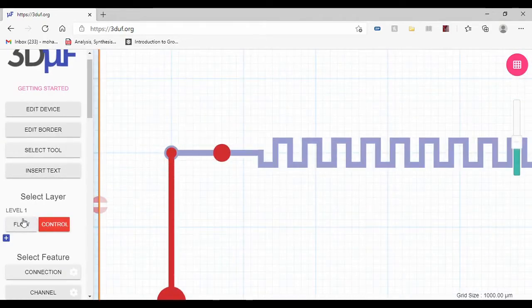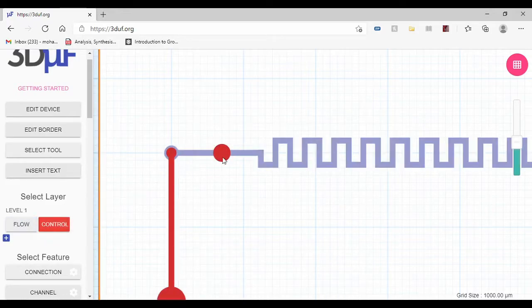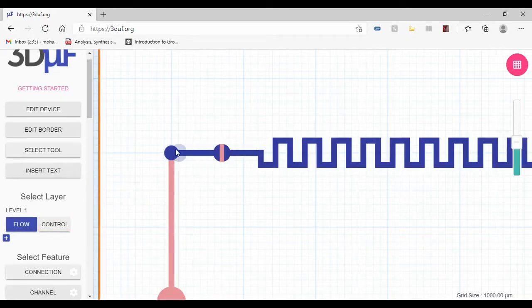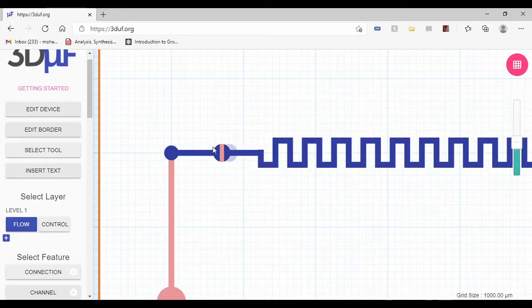And how the 3D valve works is that when I have the fluid in the blue channel and it's going right there, if the red port has fluid inside it, it's going to stop the fluid inside the blue channel from proceeding. But if it doesn't contain anything, the fluid inside the blue channel is going to proceed. It's going to go up to the control layer, and then it's going to go down to the blue channel right there, and it's going to proceed to the output.